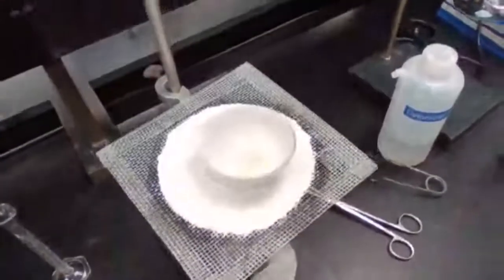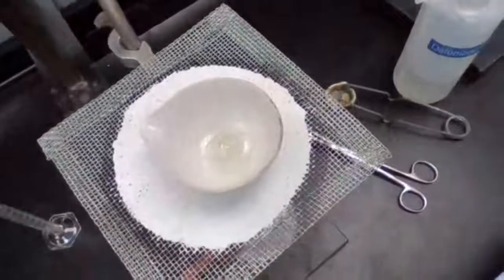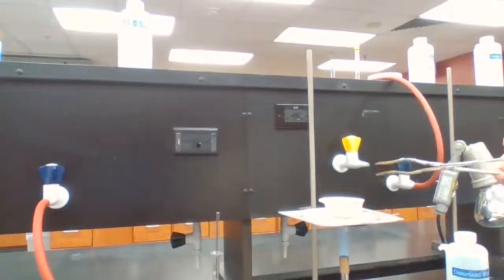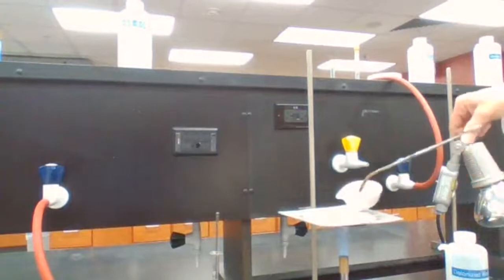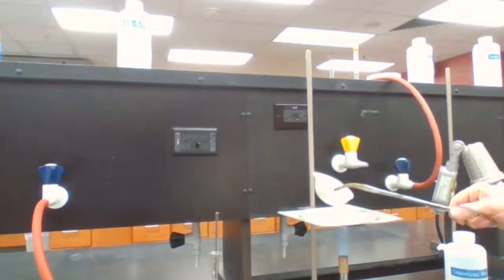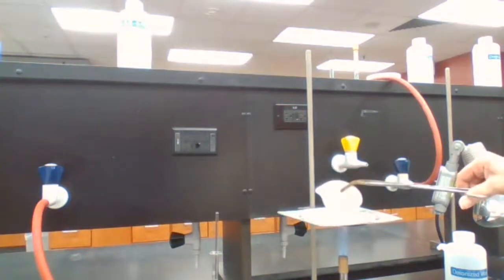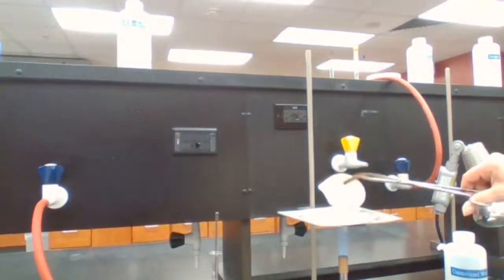Okay. See it for yourself. Almost there. The water is gone.